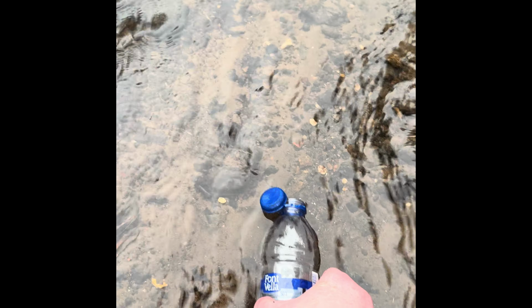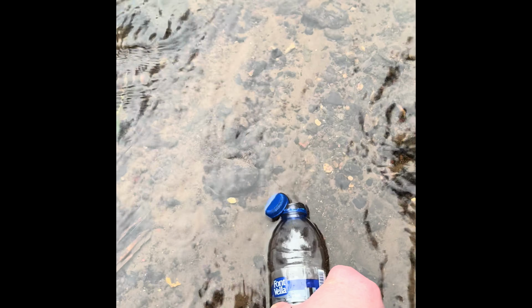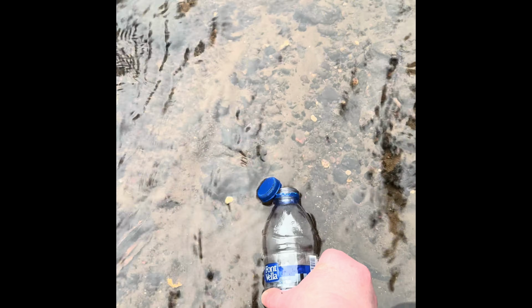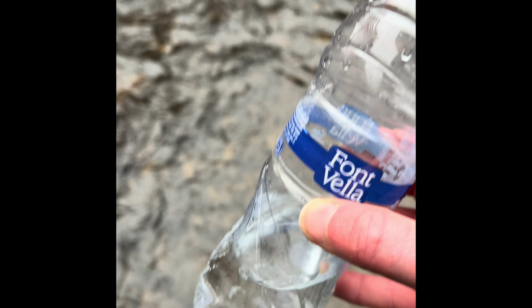There you go. So I'm just collecting some water. It looks pretty clear. I just need to get a bit more.